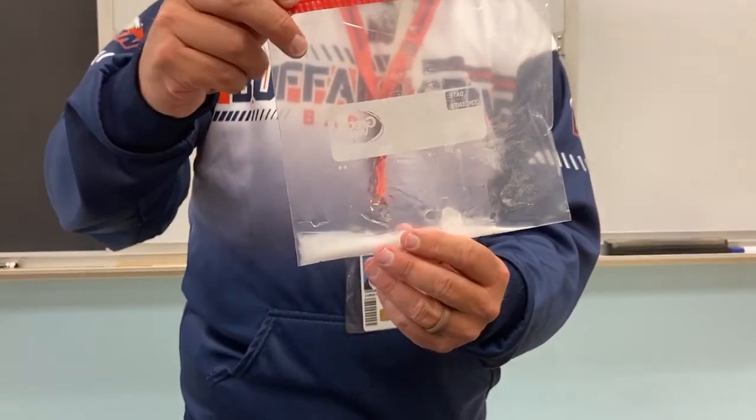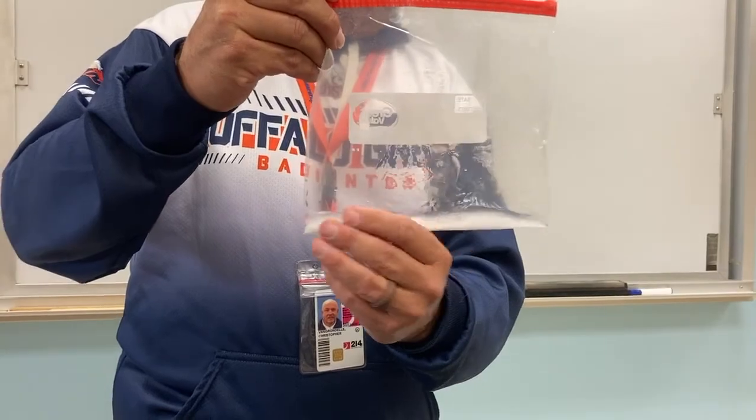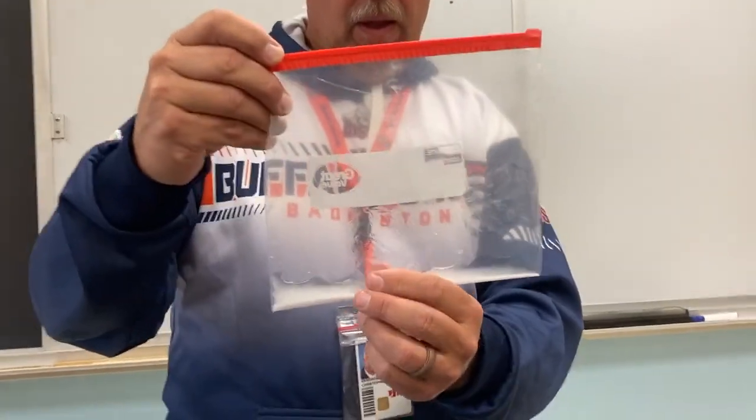As we're doing this, you might notice that we're not really measuring out the amounts, because this experiment is what we call qualitative, not quantitative. It doesn't matter about the amount. It matters about the observations you're making. What are you seeing, speaking of observations?